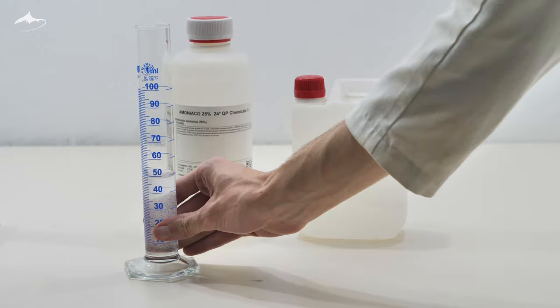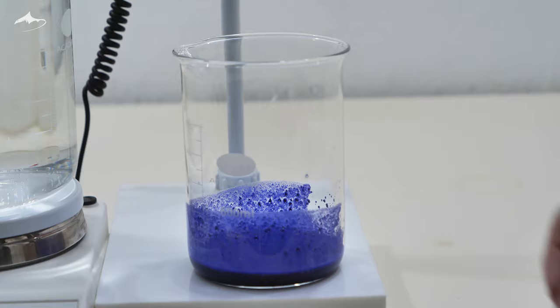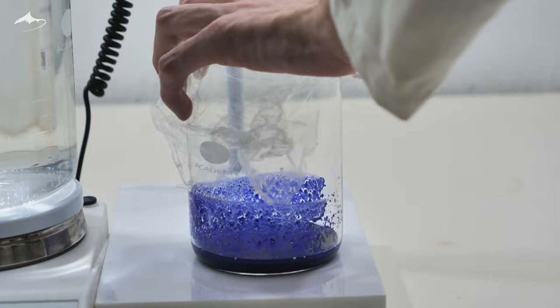Here I am preparing 50 ml of 1 to 1 ethanol to concentrated 25% ammonia solution. It was then poured into the beaker in small portions, stirring it between each addition. The salt won't dissolve completely at this temperature so heat is needed.